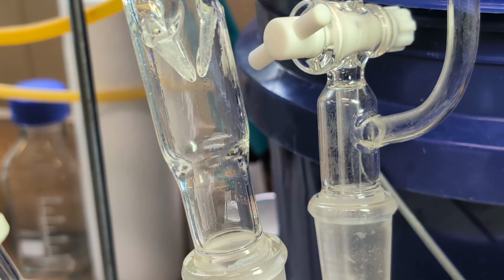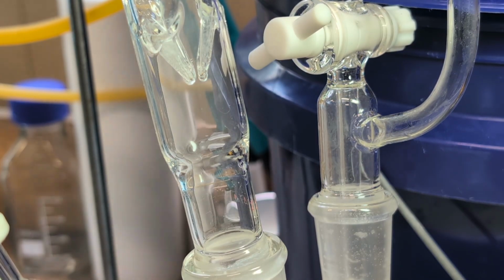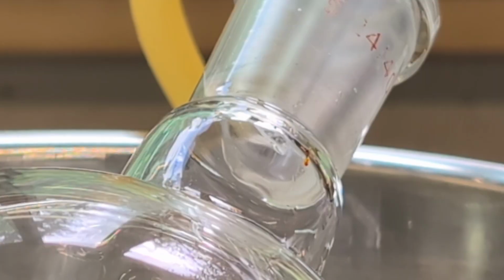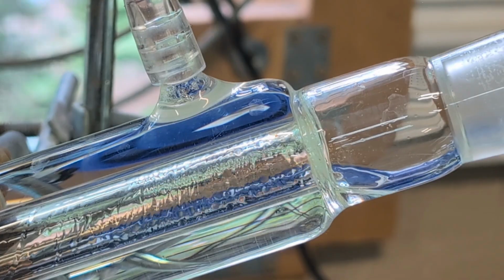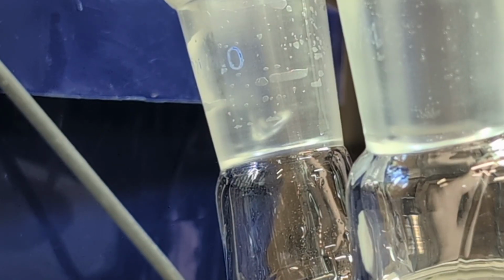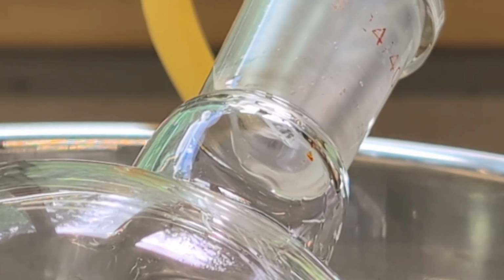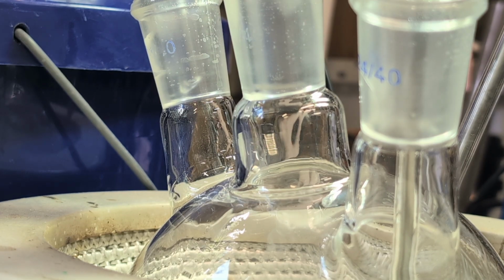Once the first ether vapors begin ascending the fractionating column, I gradually add the ethanol and maintain an addition rate that matches the rate of diethyl ether production. From this point on, I had to constantly monitor the reaction temperature, the heating mantle setting, and the balance between ethanol addition and ether production, as several positive feedback loops kept pushing the reaction out of its optimal range.